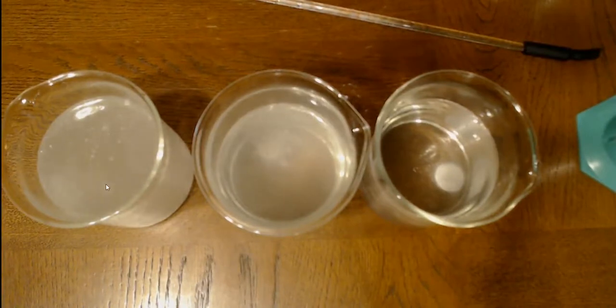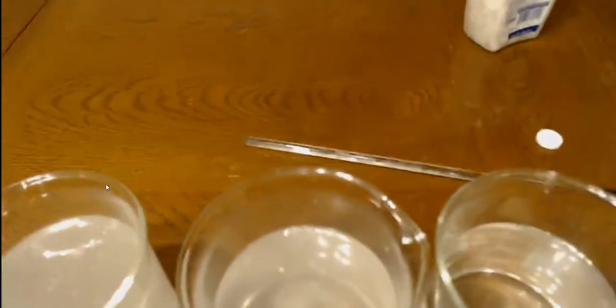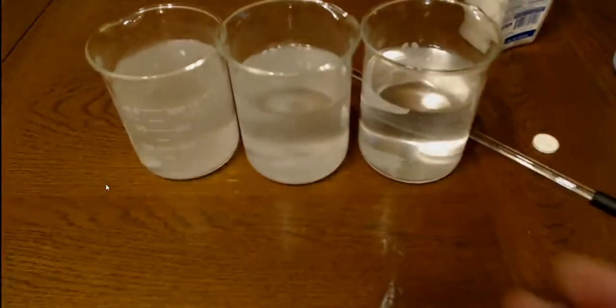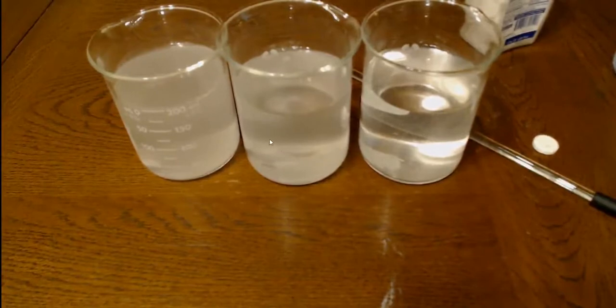Might see them better from the side. I'm going to try something here with my camera. We'll see if it works or not. Okay, so we got this. There we go. So you can see this one right here bubbling on the bottom. This one sitting right here is bubbling pretty good too, and this one is nice and easy to see.